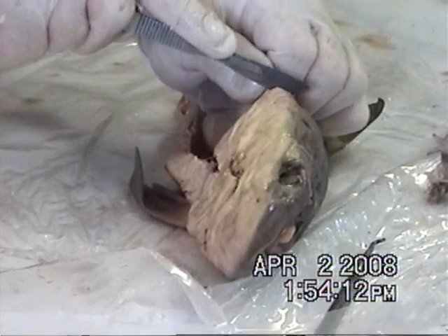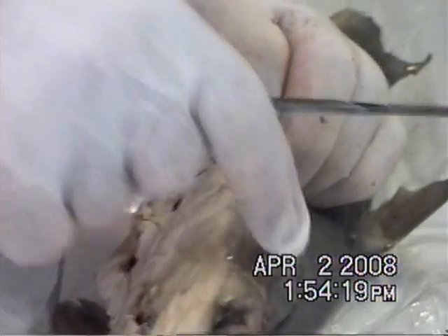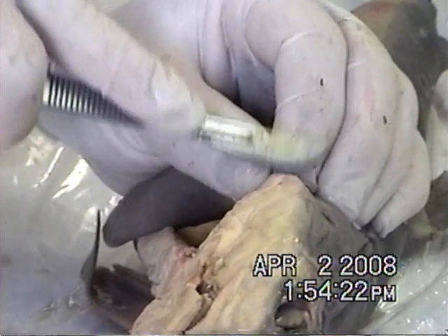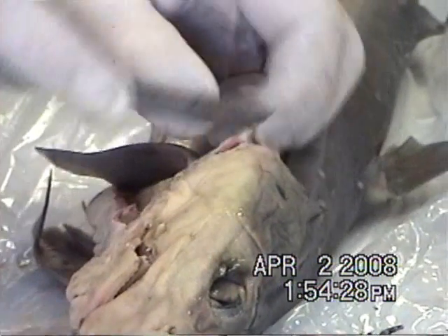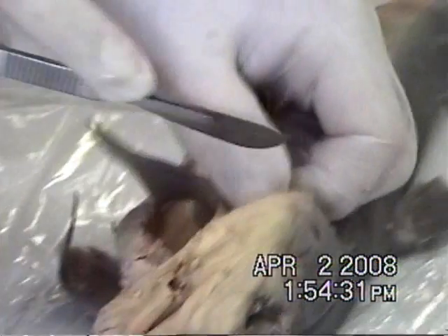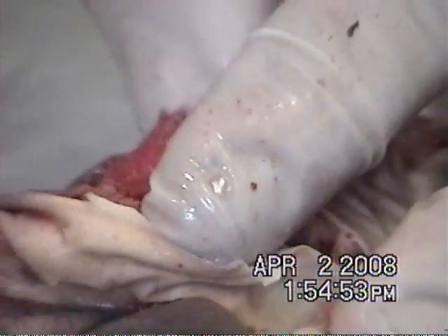I have a new technique for the gill. I'm going to give you a view of the gill. This thing has nothing inside. People who keep talking about eating and feeding this thing — you need to realize this thing is filled with preservatives. Something that could kill you. These are different sides.